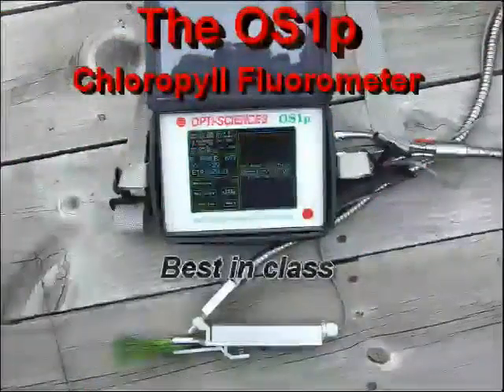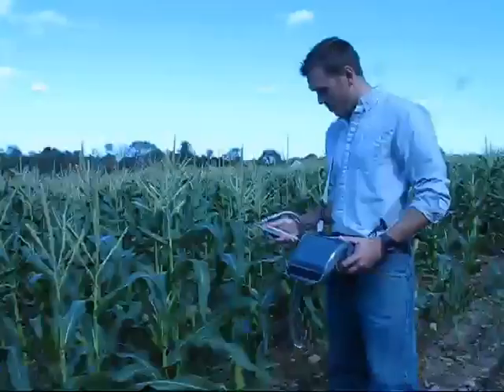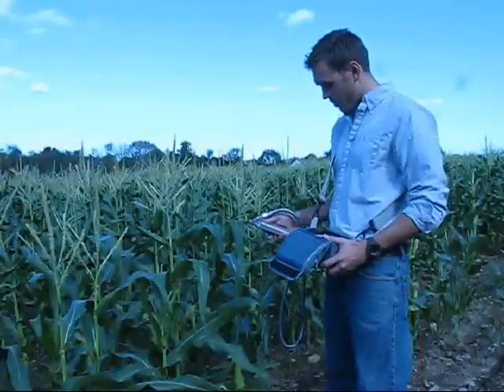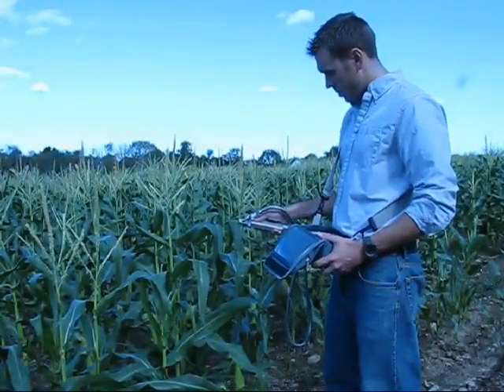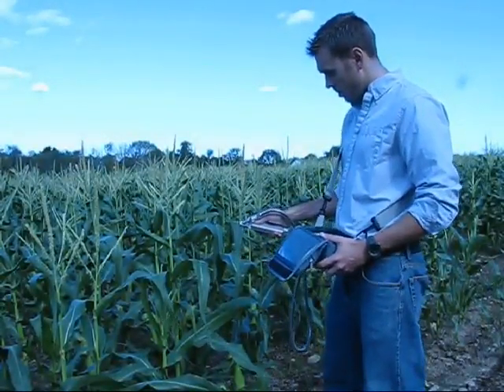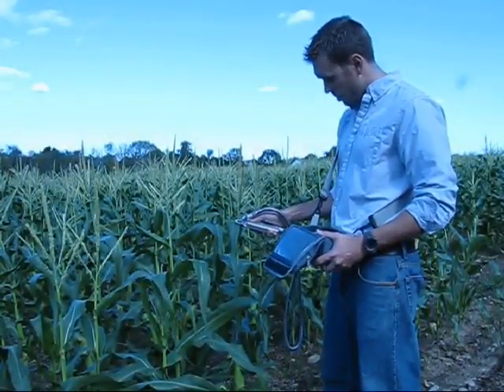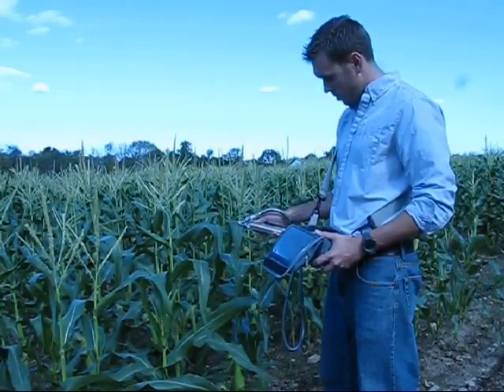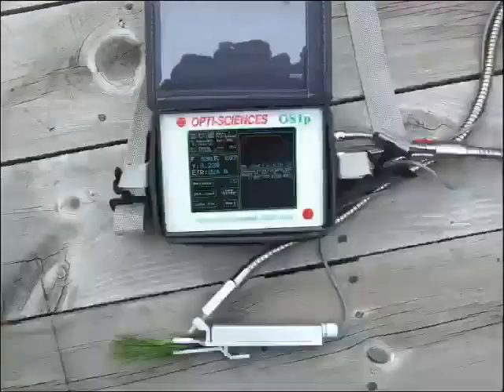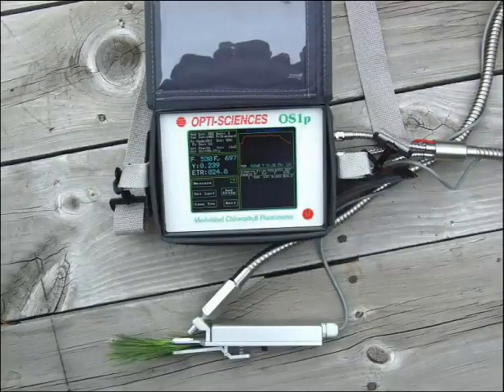The OS-1P: best in class. The OS-1P is a field-portable modulated chlorophyll fluorometer that was designed to be easier to use and provide greater capability than any instrument in its class.